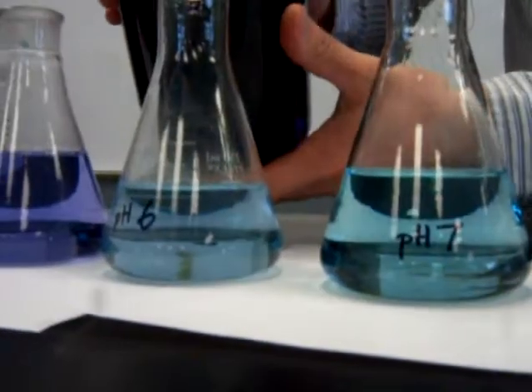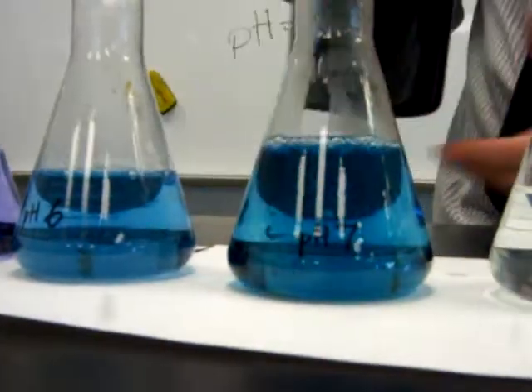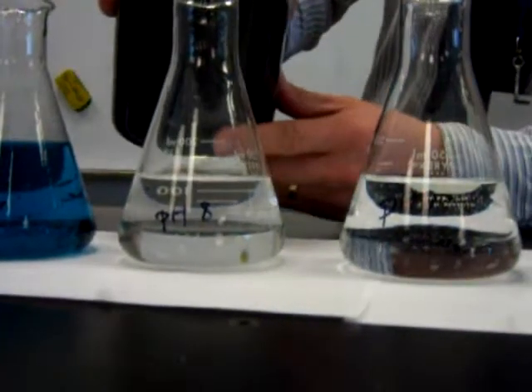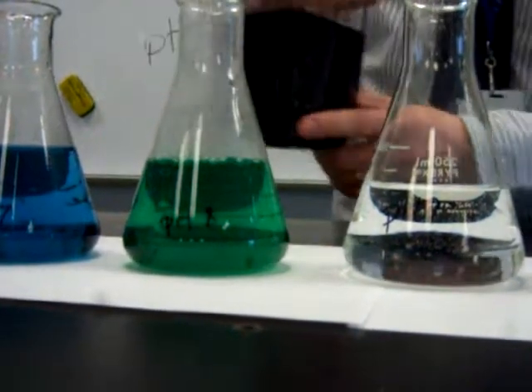You can force it in six too — yeah, six and seven actually. We've got plenty of cabbage. This is a rainbow! We need a picture of this once we're done — take a picture all the way down. Now we're going to the basic side. Oh, that is so cool!